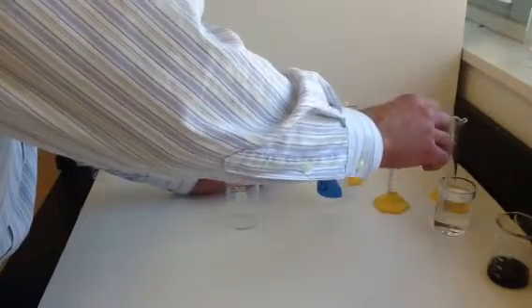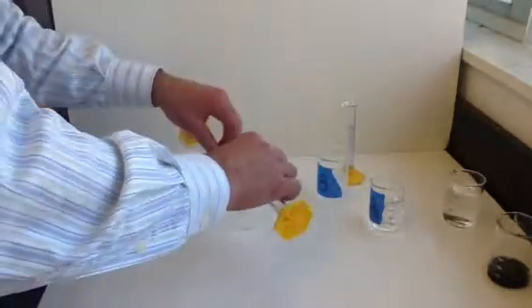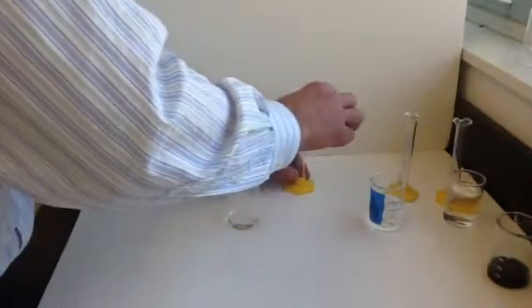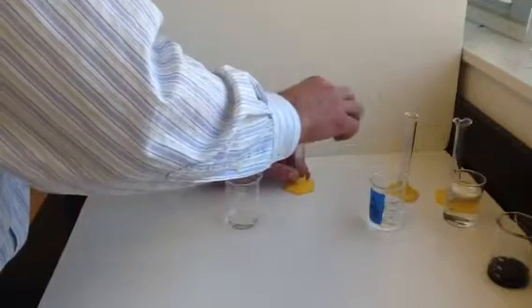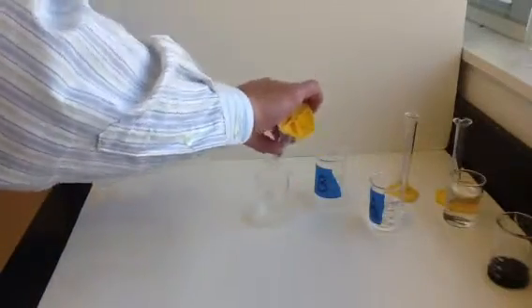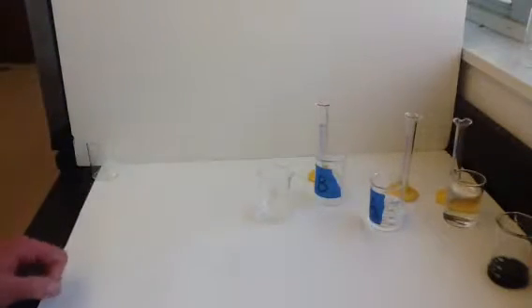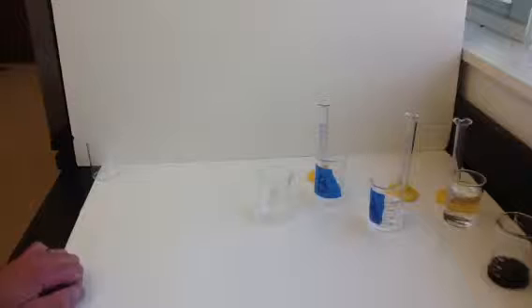In our next trial, we're going to have 7 milliliters of A. And we'll combine that with 3 milliliters of, sorry, 3 milliliters of water. So the water is to dilute A and keep the total volume the same. So I'll put those in here. And then still 10 milliliters of B. So this time we're using 7 milliliters of A, but our total volume stays the same. So we'll pour that in. We'll mix it a bit to get started. And you can time how long that takes to have a color change occur.